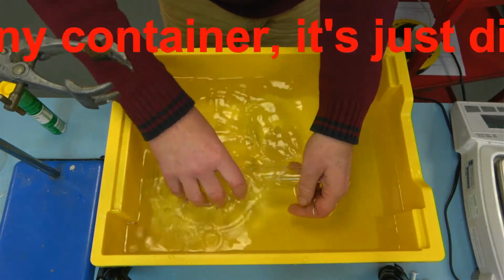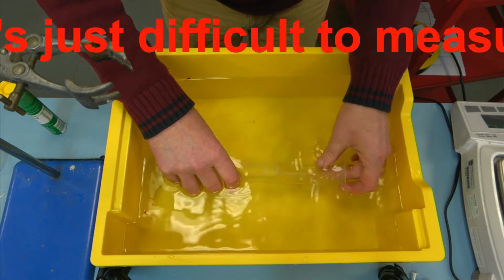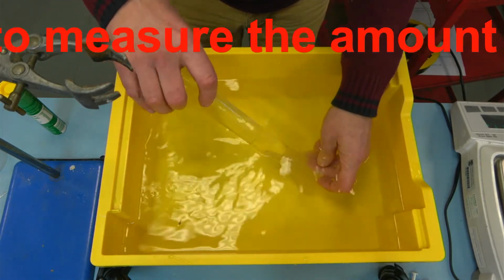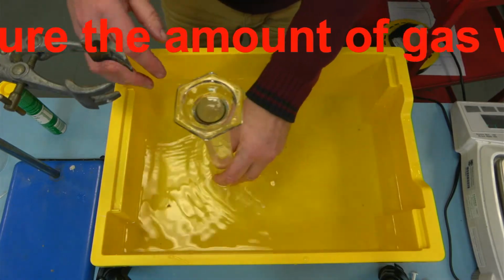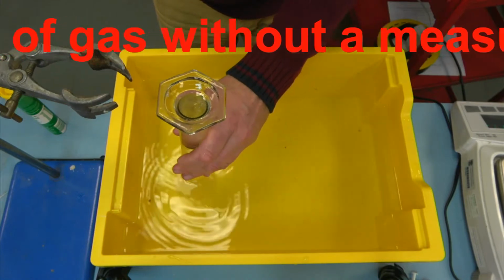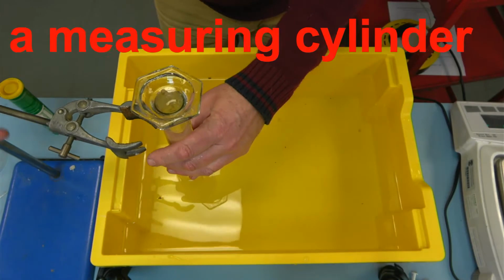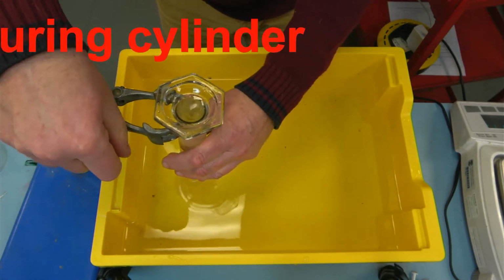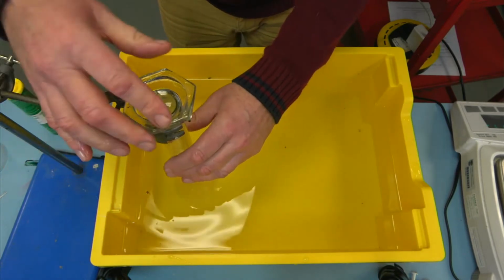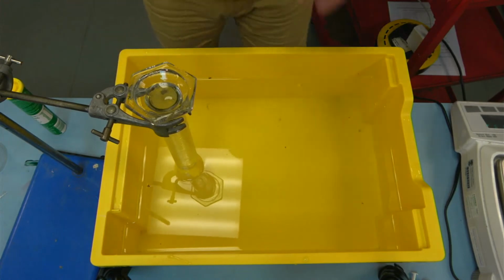And this is the fiddly bit. So here's how I do it. You need a bucket obviously, or something to put it in. Put it on like that so the funnel is inside the end of the measuring cylinder. Stand it up. Now I have the advantage that I have clamp stands and not enough hands. So let's just bring that across, open up the clamp stand. I'm not holding it tight, it can still move around. So what I've got now is a measuring cylinder full of water.